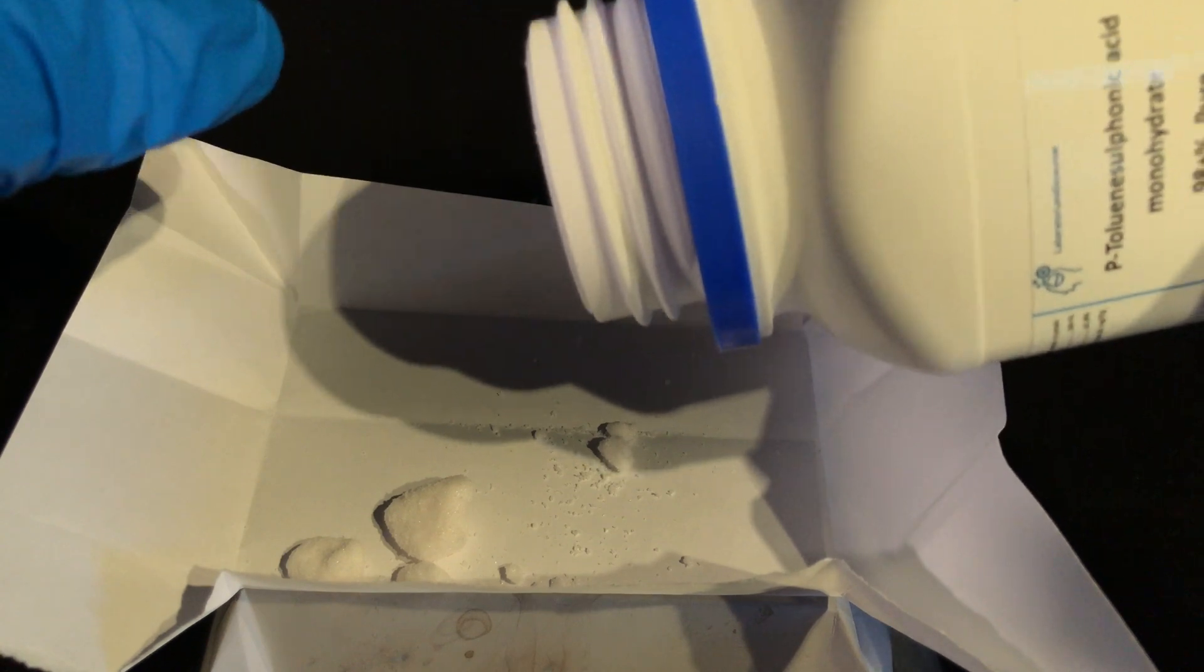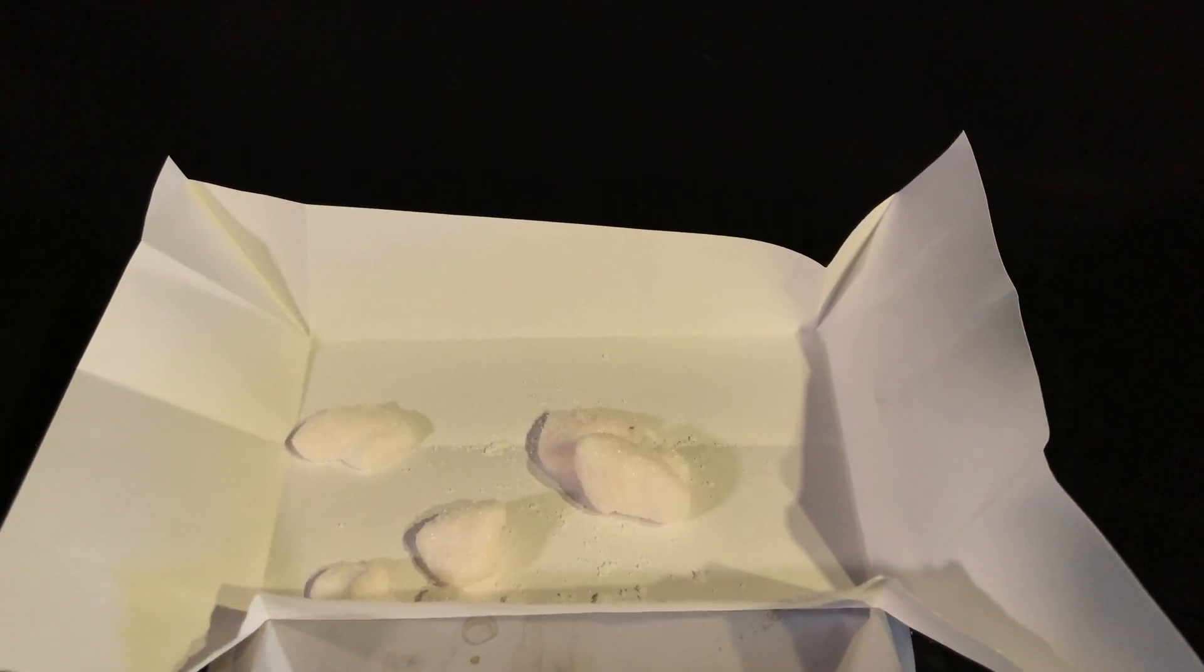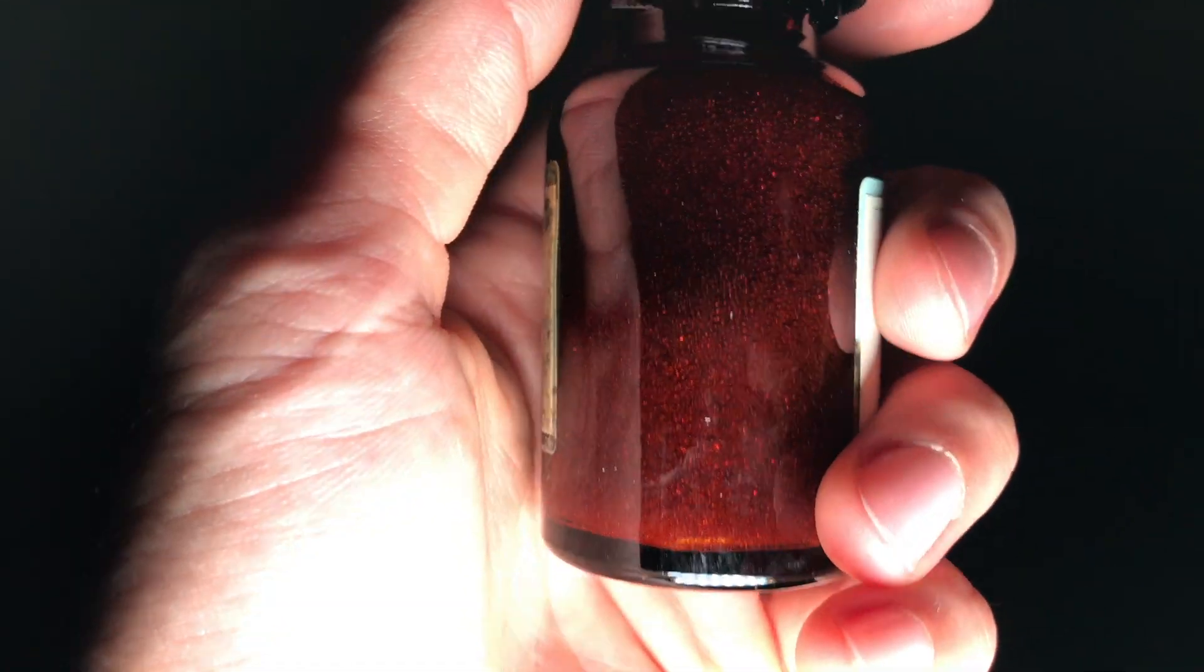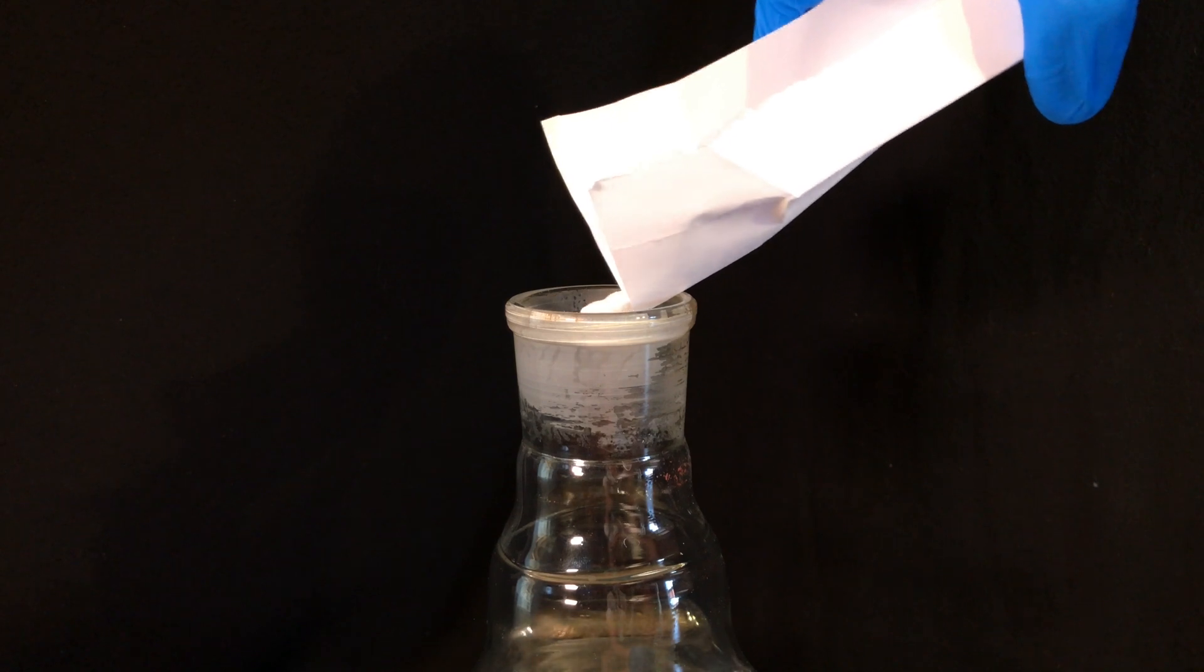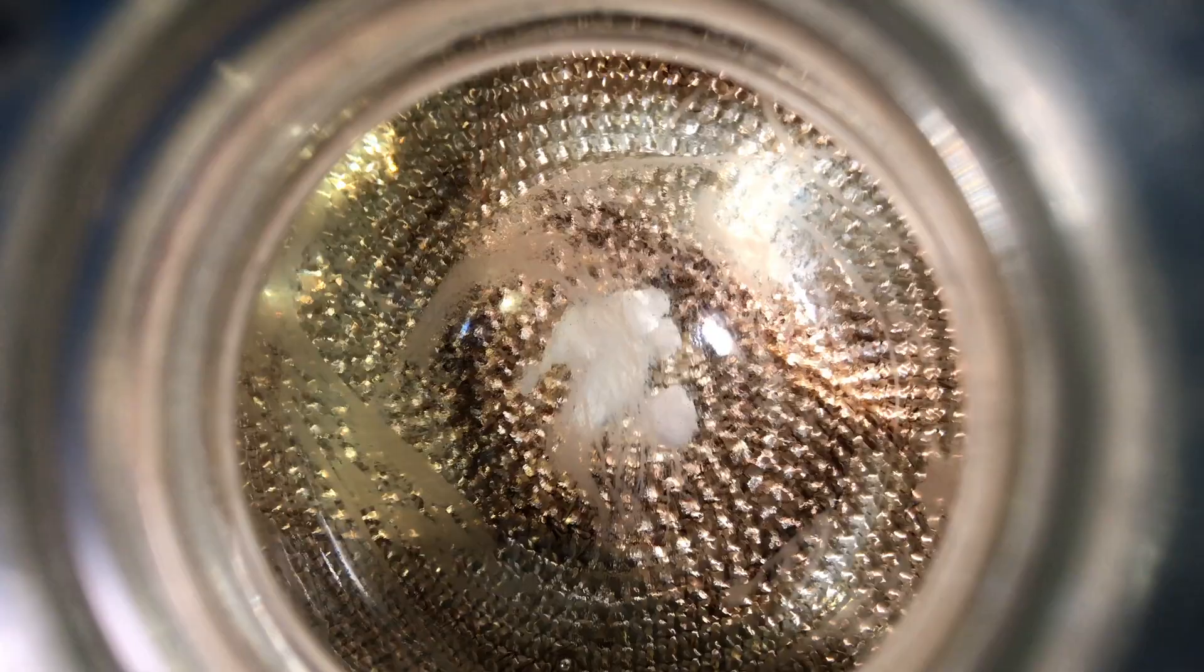I ended up choosing p-toluenesulfonic acid but even sulfuric acid should work. The paper used strongly acidic ion exchange resin which I also have but I think it's inconvenient. The catalyst was added and now we're finally able to start with the actual reaction.